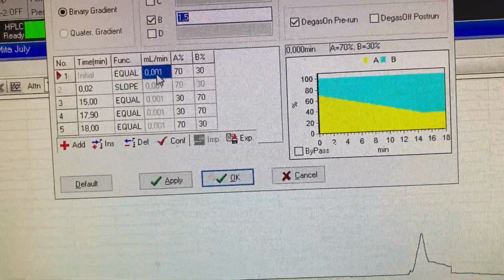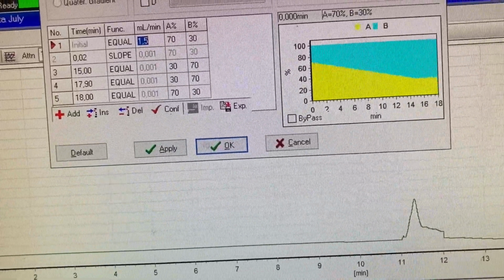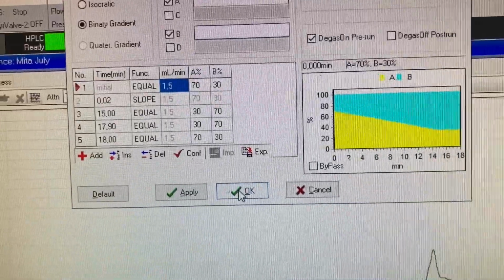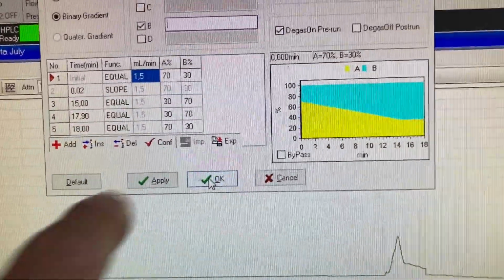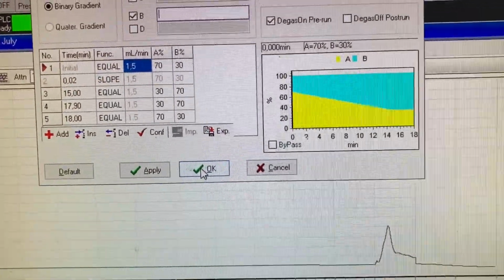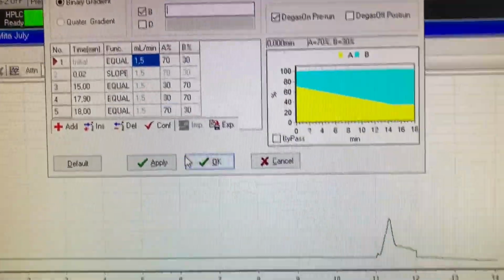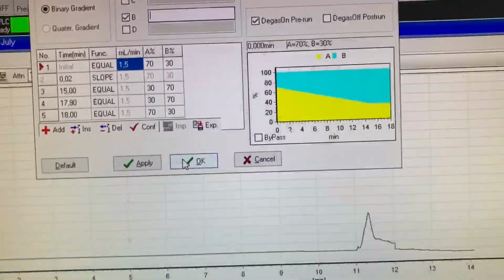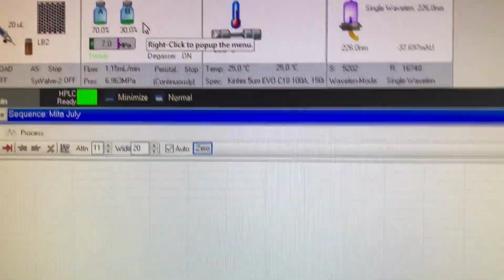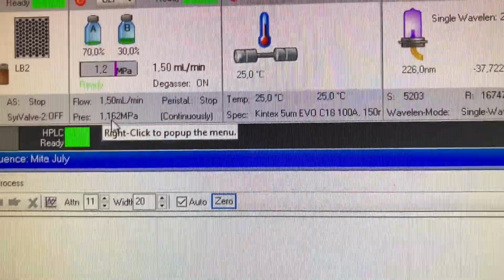copy and paste, and then push OK. The reason is because for some reason it's not allowing me to put 1.5 there. I can put 2, I can put 1, but I can't put point anything. This is the solution I'm using to get around it. I haven't found a fix for the software yet. And then push OK, and see that's changed. Binary gradient now, and the pressure is coming up.